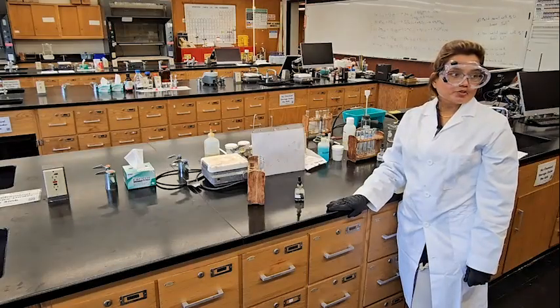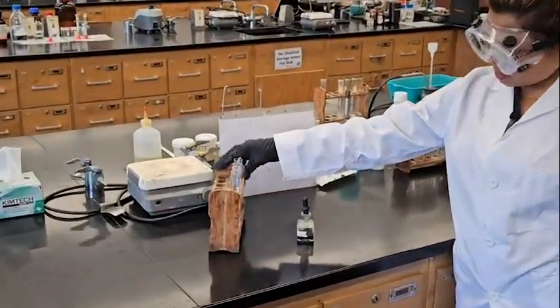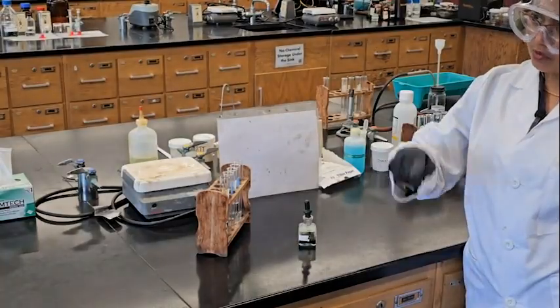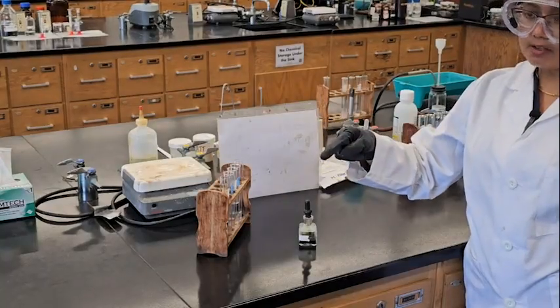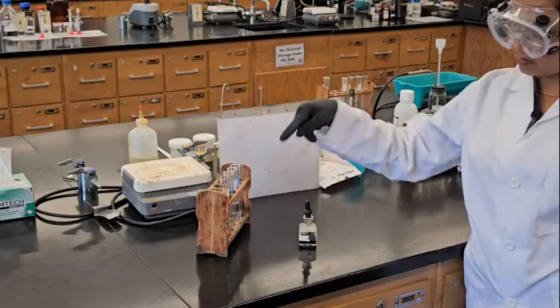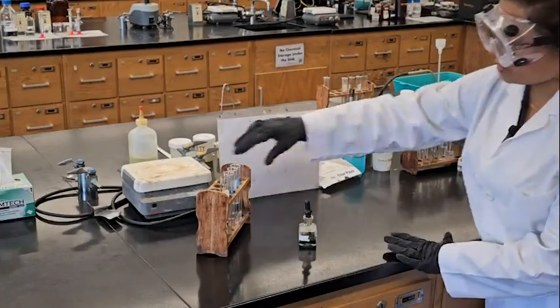Now we are going to do part 4, which is the pH test. These are all the original solutions. They are basically from the pure element which reacts with the oxygen and gives us the oxide, and this oxide reacts with the water, because in the jar we have a little bit of water. We need this water for the pH test. Now we are going to do the pH test for each of them.